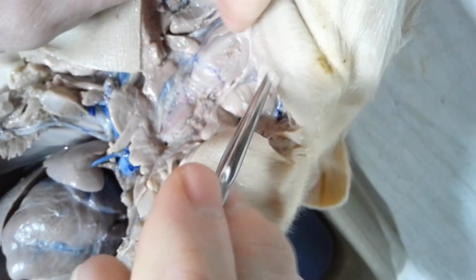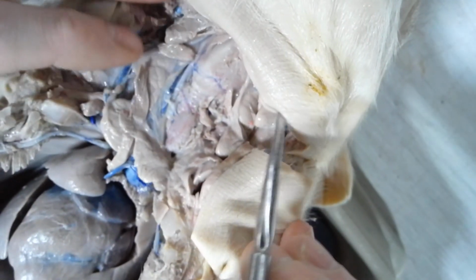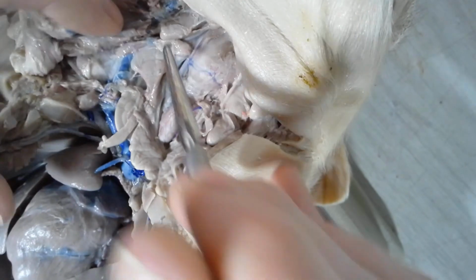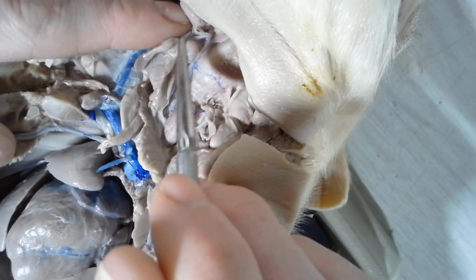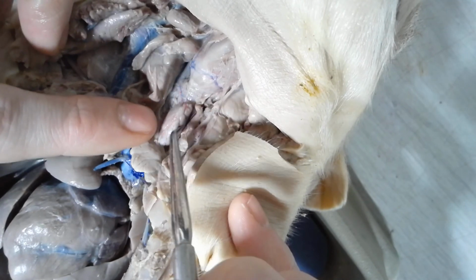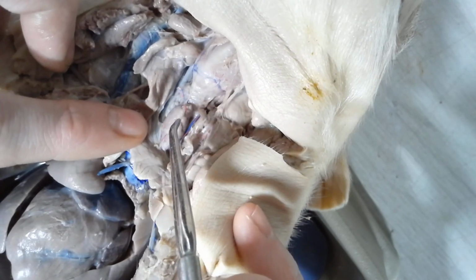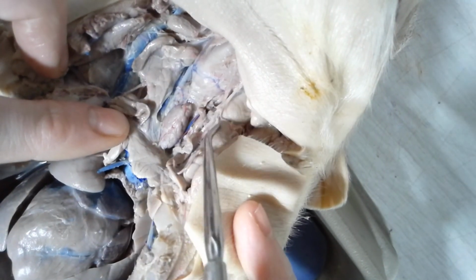Alright, so if I just orient myself a little bit here with the neck. Okay, so the neck area, the first thing that you want to focus on are a couple sets of glands that you see on the neck here. The first set of glands I'm going to show you are the thymus glands. The thymus glands are these long glands that are right along the side right here, and they're also found on the side right here. And then you have this oval gland right in the middle. This is called the thyroid. It's right in the same location where we will find our thyroid gland. So thyroid is in the middle, thymus glands on the sides.